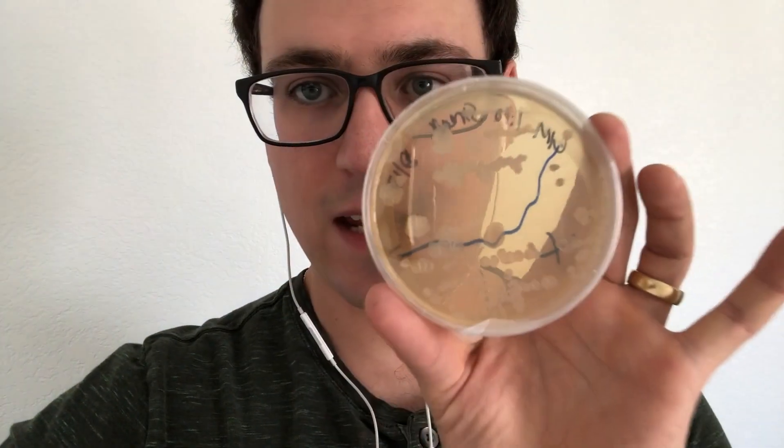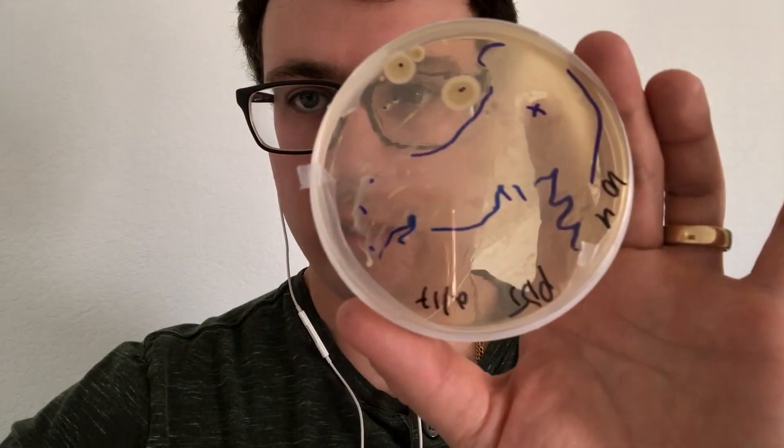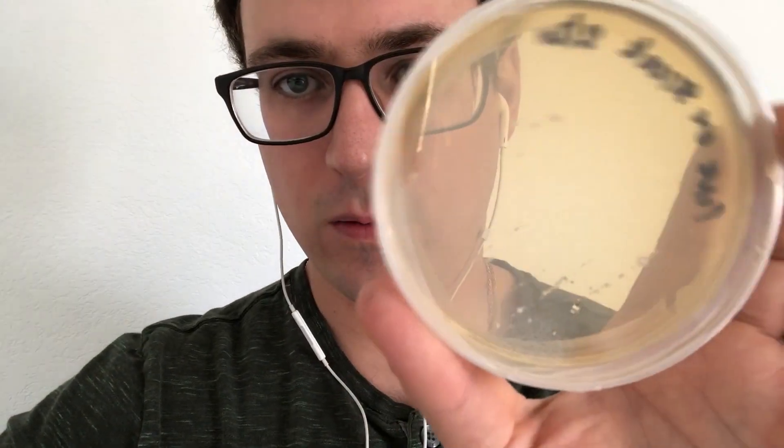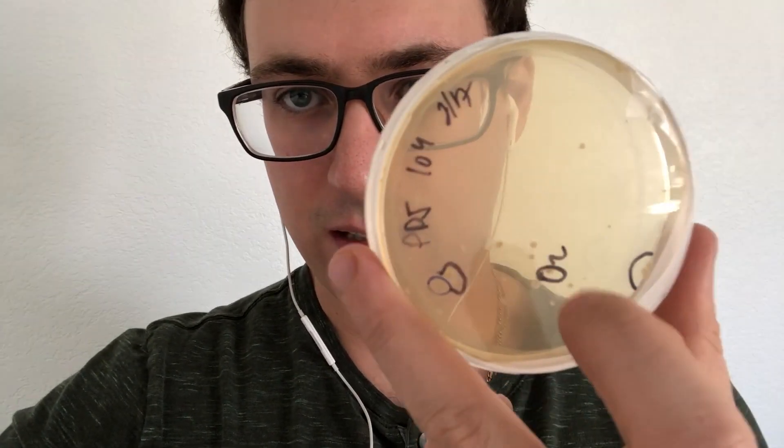So I'm going to go ahead and biohazard all these plates from early on that you can see got taken over with bacteria. But I will go set up and then show you how I transfer my isolate colonies onto their own plates. And I'm going to go ahead and label all these kind as they appear.